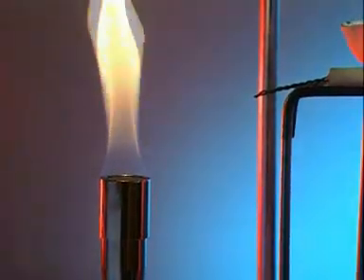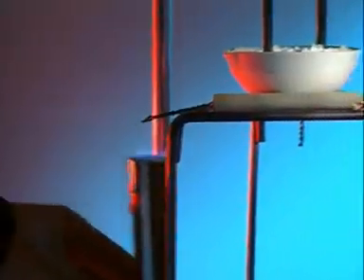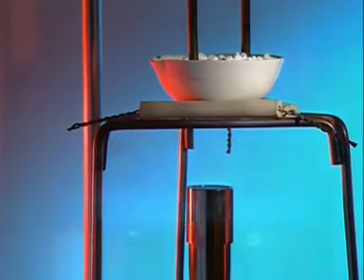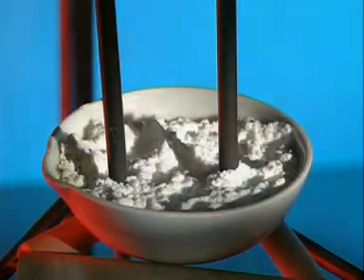Solid lead bromide doesn't conduct electricity, it needs to be molten. Lead bromide melts at 370 degrees Celsius.